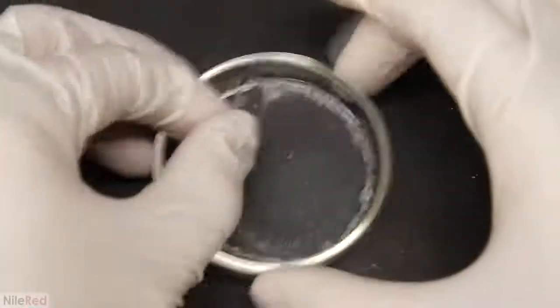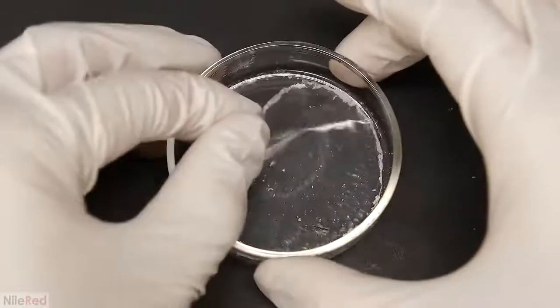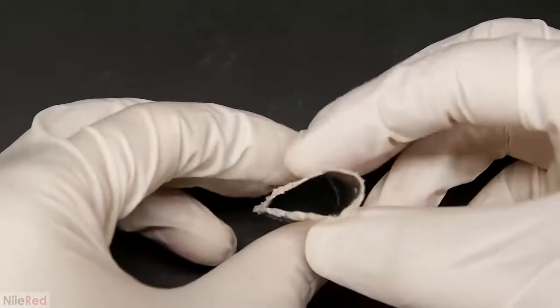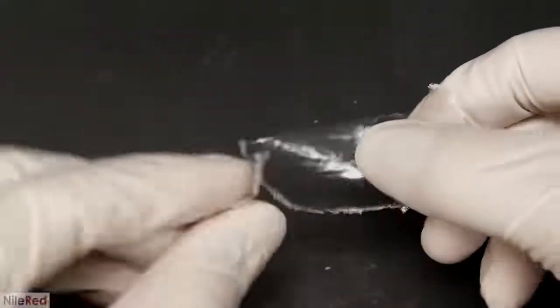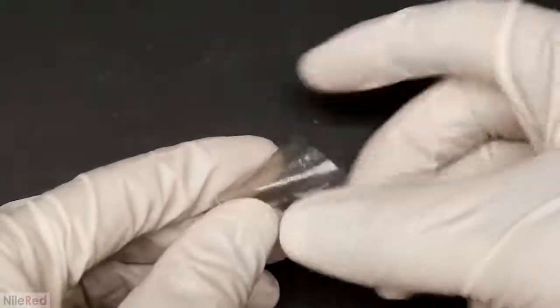I then did it again with a 20% mixture of triacetin, and I let it evaporate very slowly. The film it made was quite strong, and it seemed to be more flexible than the diacetate was. I think this film might have just been thinner though. Anyway, keep in mind that the stuff I'm using isn't super pure, and that the impurities might affect the final properties of the plastic.